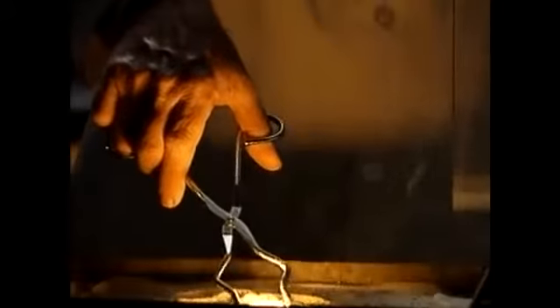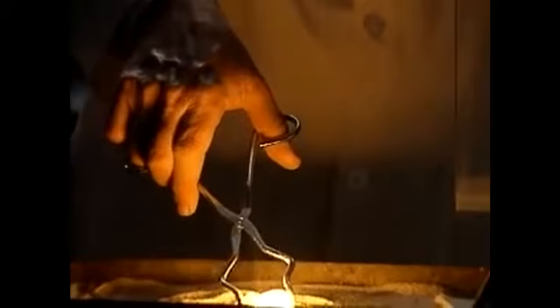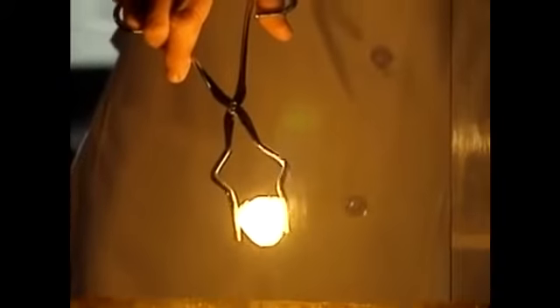Now we can take a look at the molten metal by carefully lifting it out of the sand. This white-hot iron is encased in a crucible of glass that has been made by melting the sand. You can see some of the liquid metal as it dripped out of the glass.